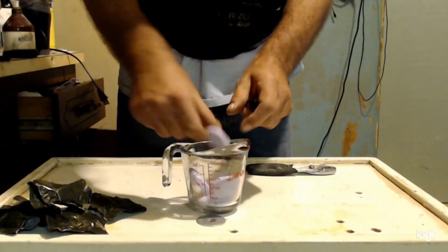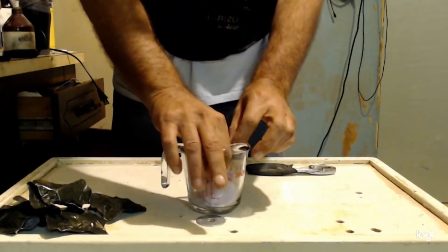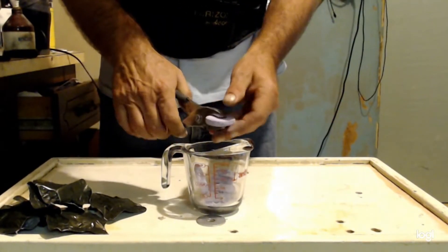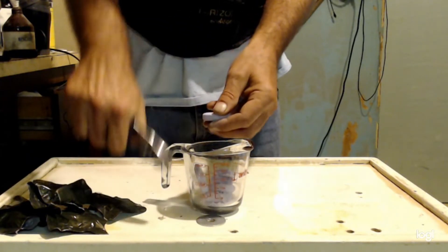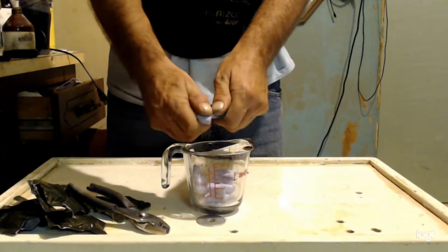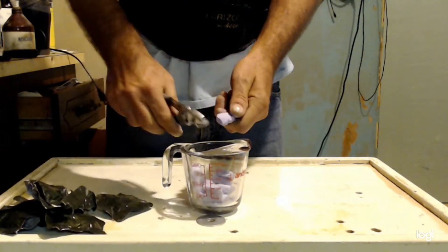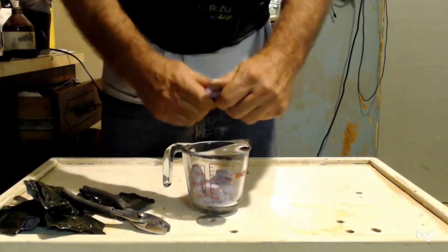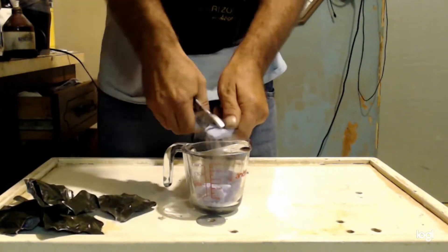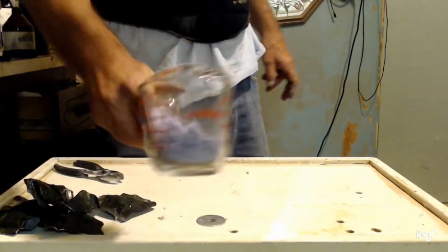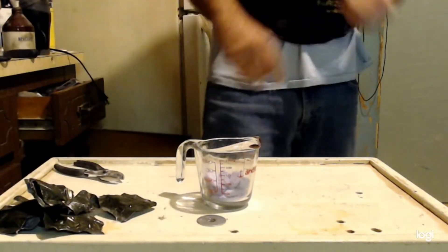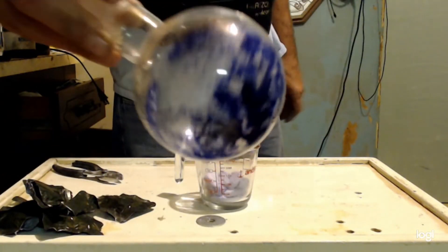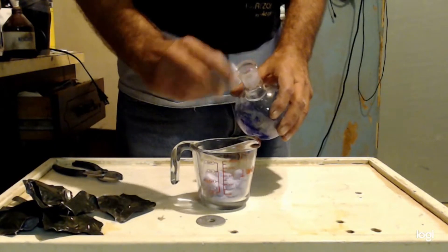You can break these with your fingers. Some of them are hard. If you find one like this, I just get a pair of pliers, squeeze it a little bit, and it'll break easy after that. You want small enough pieces so that you can get them into your round bottom flask. Once they're that small, that's as small as they need to be broken up. Now I already did this experiment once and you can see it has some crap in it. I'm just going to put these pieces into here.